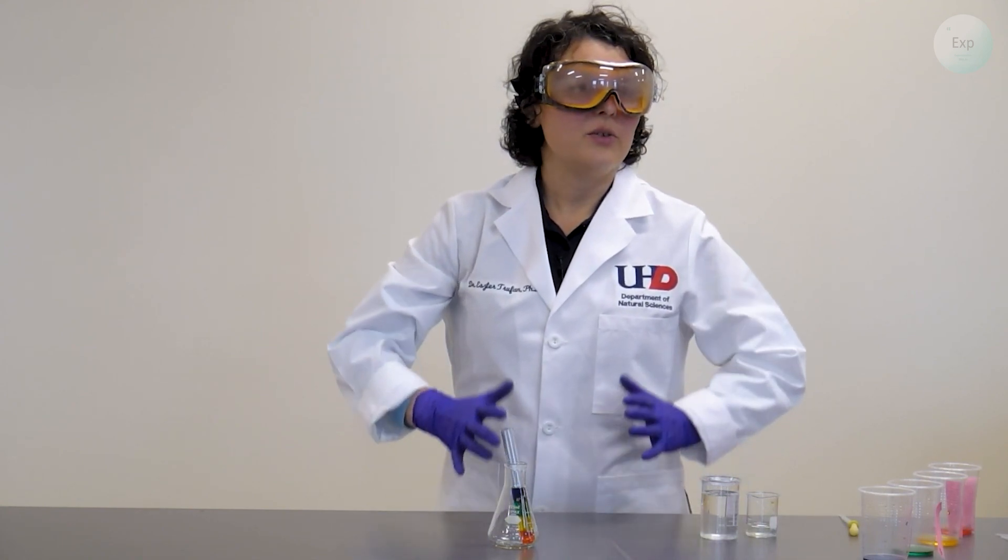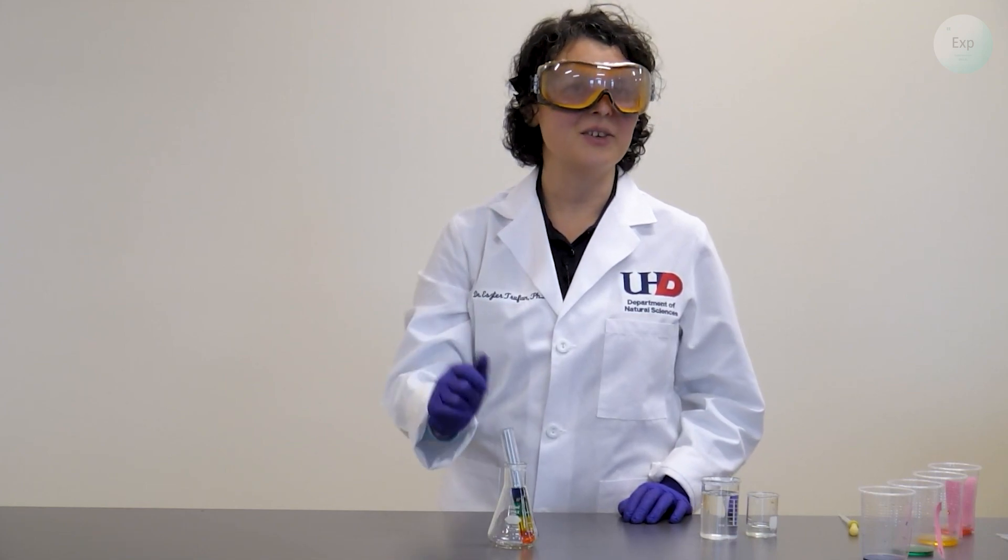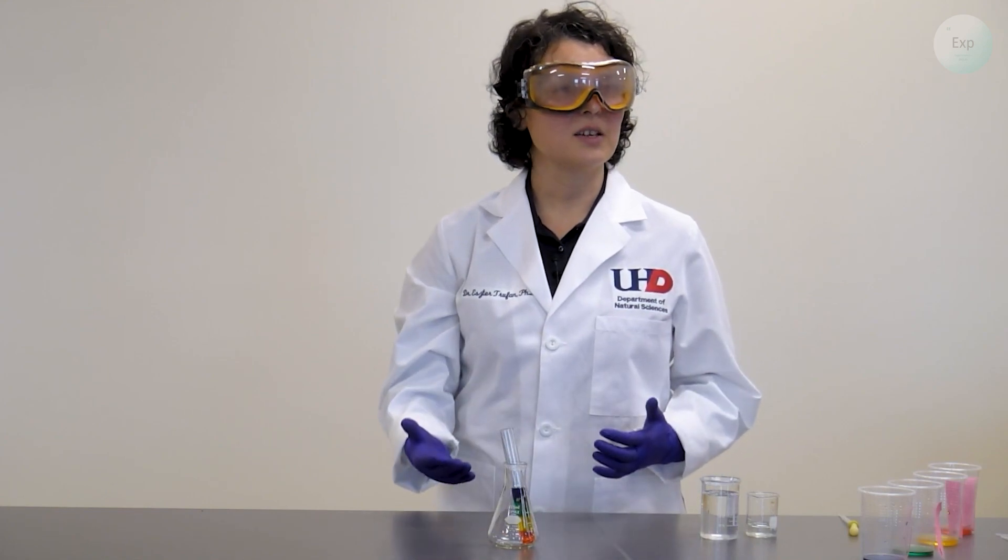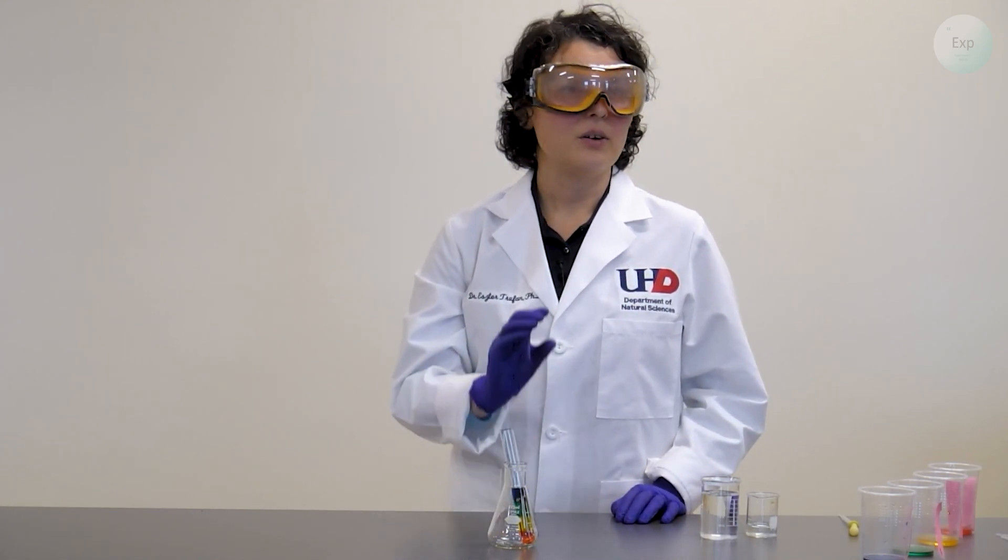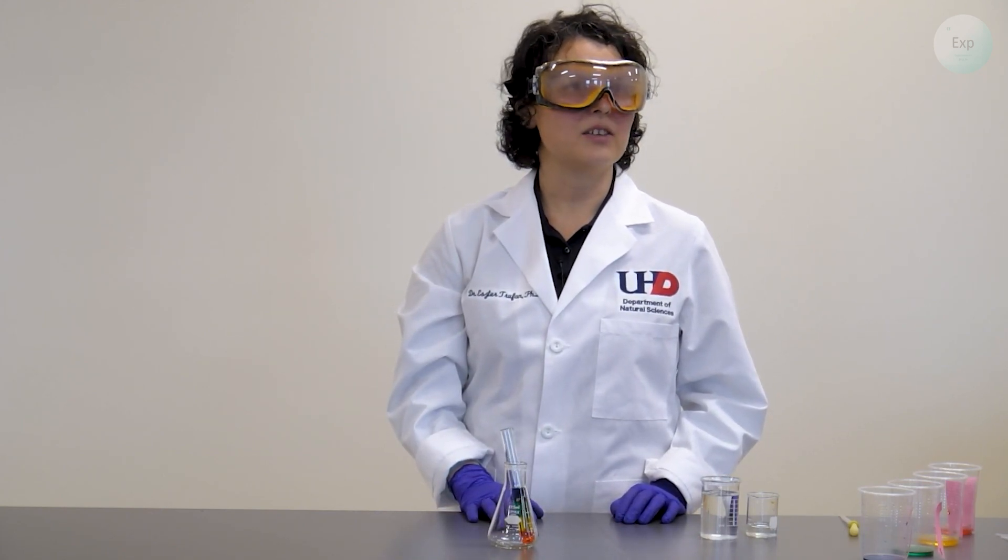Next, you can do your own experiments from here. You could try shaking your test tube and seeing what happens. You could try cleaning your test tube, rinsing it with water and drying it completely, and then trying to layer your solution in a different order to see if they would layer similarly.